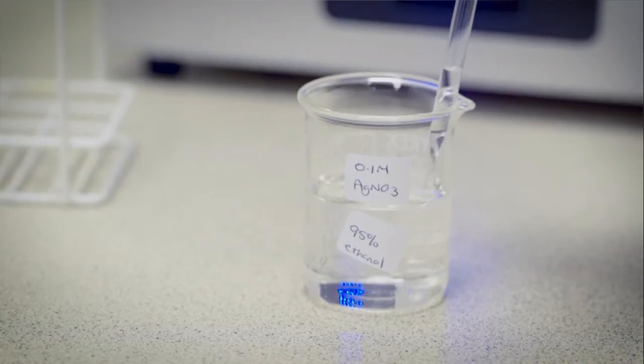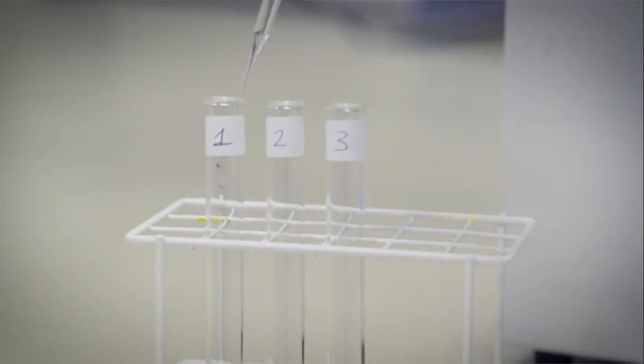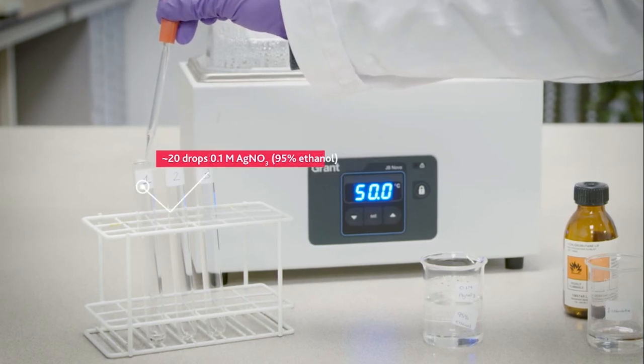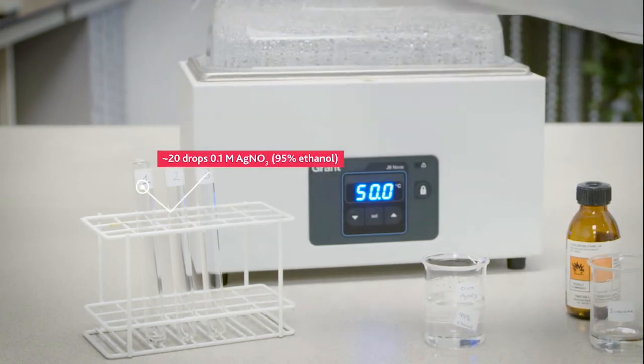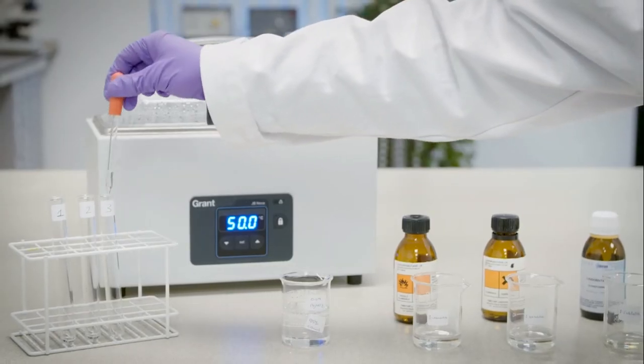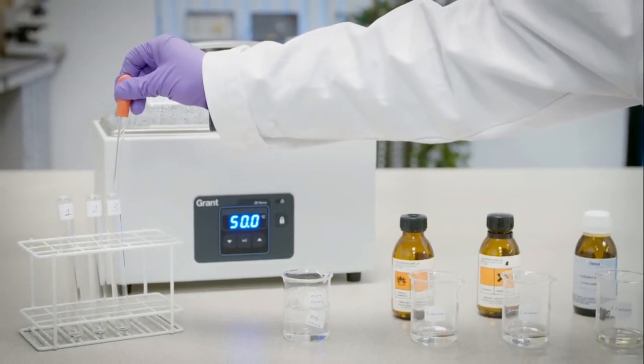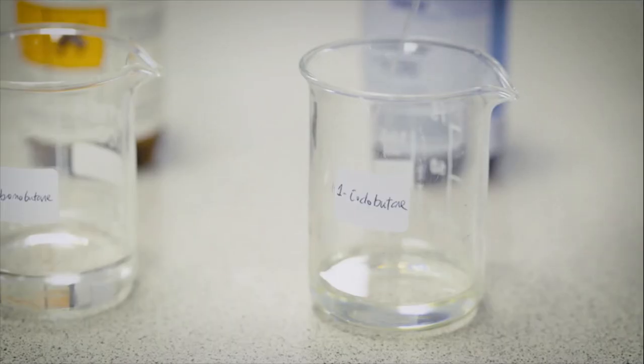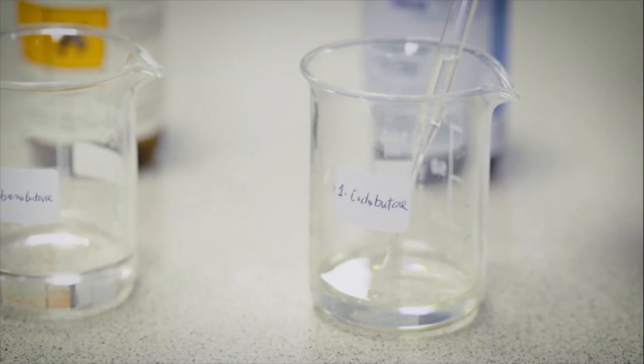First, silver nitrate solution is added to three clean test tubes. Then, one iodobutane is added to test tube 1.